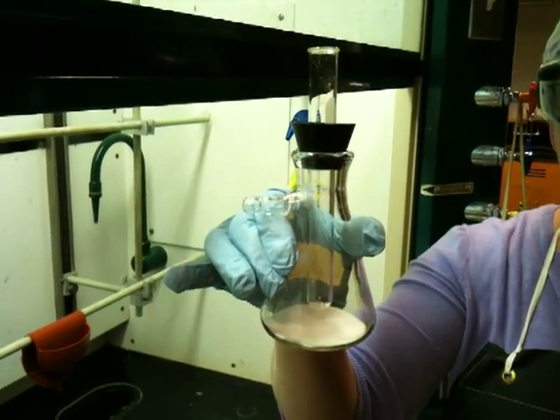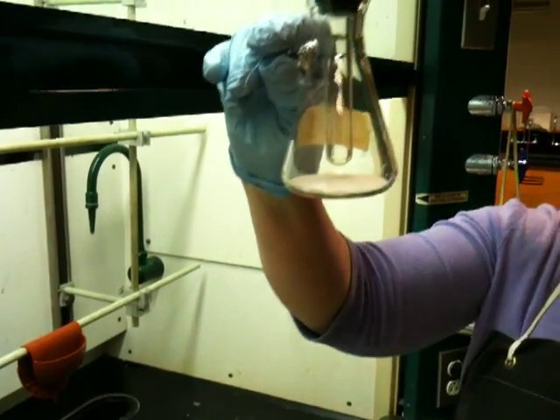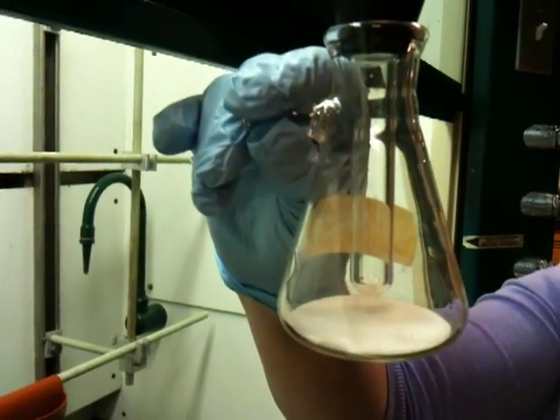Take this piece of parafilm, fold it in half, and put it on the test tube about two-thirds of the way up, and then start stretching it and sticking it to the test tube. This makes the test tube thicker. When it's thicker, it will be able to sit properly in the black rubber adapter or the neoprene adapter. What you want ideally is for the test tube to sit about a centimeter from the bottom of the flask where the solid is.